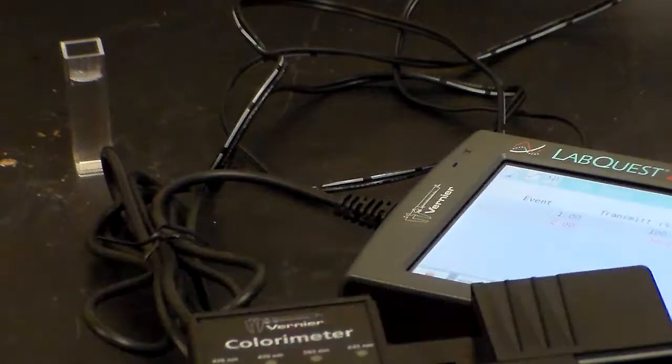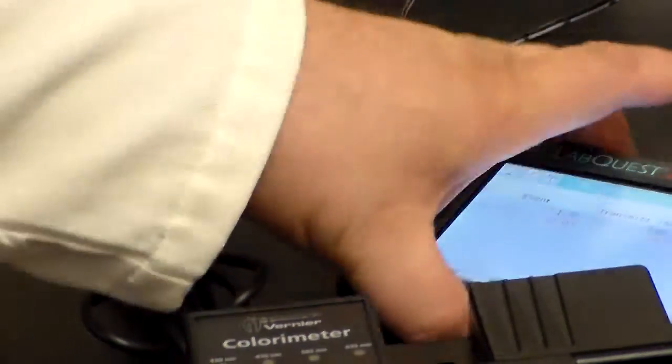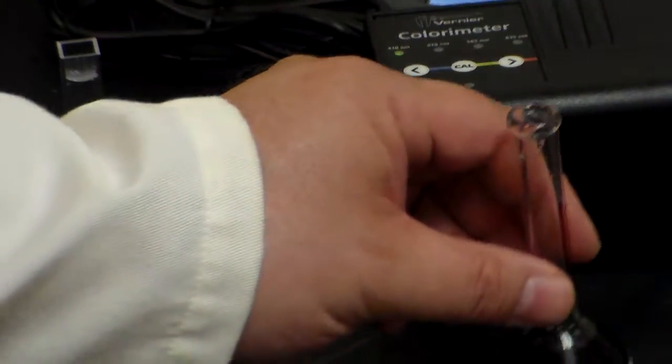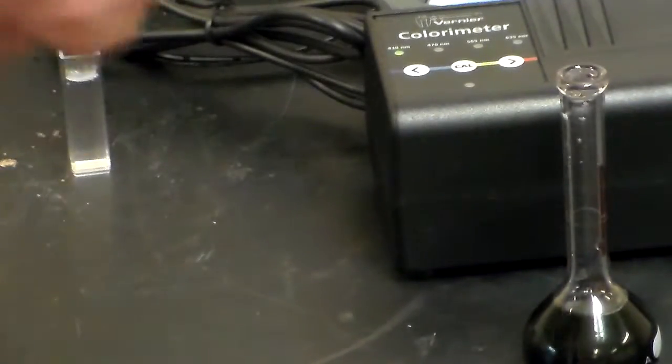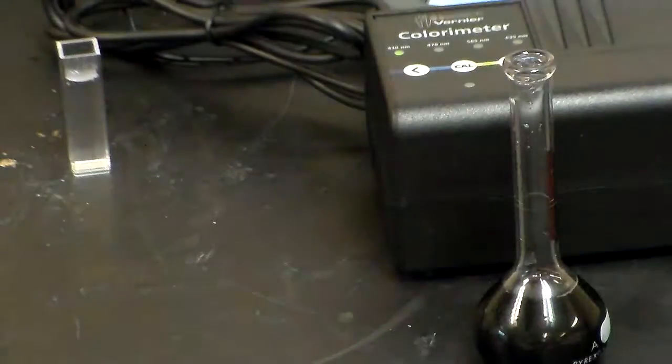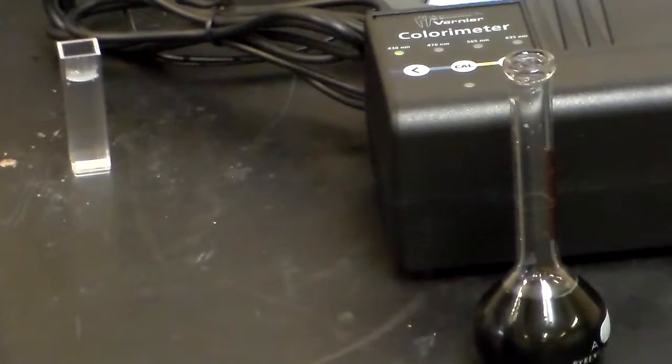But now we're going to move this away, put that off to the side. Then we're going to work with this again, so we're going to dilute it. And that's going to be the subject of another video because I am running out of time. We're going to be doing this dilution a few times for this. But that's the basic idea behind our lab.